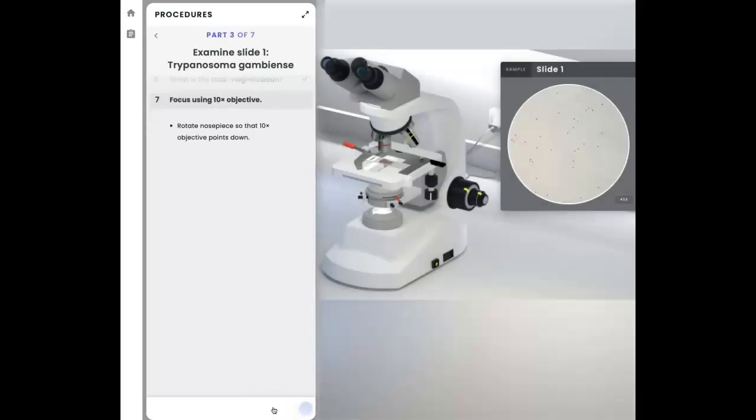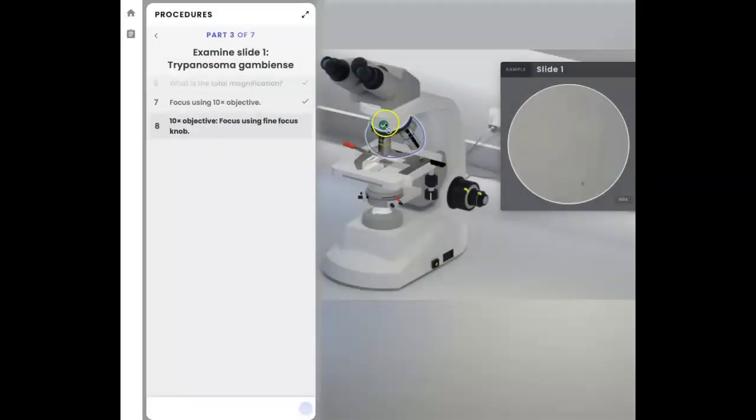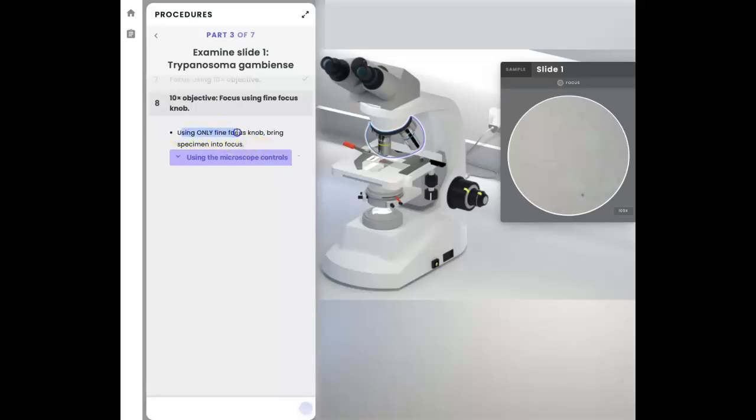We're going to switch now objectives. So now we are going to the 10x objective, and for that we need to rotate this until that snaps into place. That's the blue one is 40x, the yellow one is typically 10x. So there it is, check mark. Now using only the fine focusing knob, because once you use the coarse focusing knob, as we did in the first step, although I did not show you that, you're finished with that knob. You don't want to touch this knob again, because it is not necessary. Most microscopes are designed so that now, to make your job easier, you just play with the fine focusing knob. So let's rotate that. And again, we're going to be looking for the word focus to show up. And look at that. Here it tells us the real magnification, so we know it's 100x.